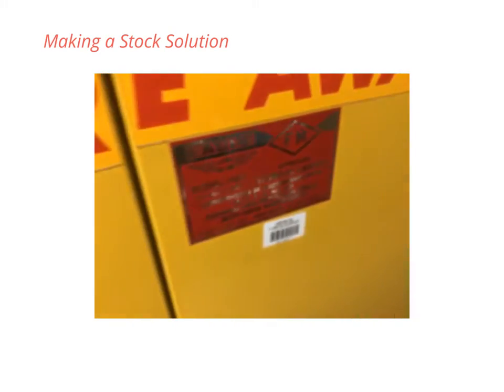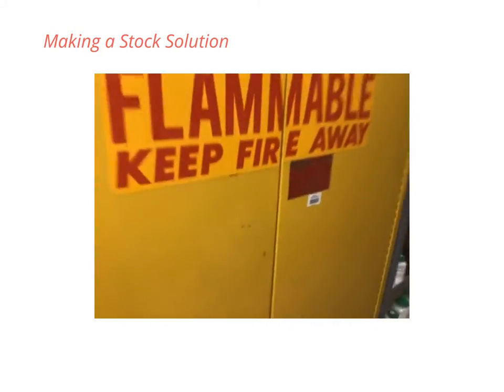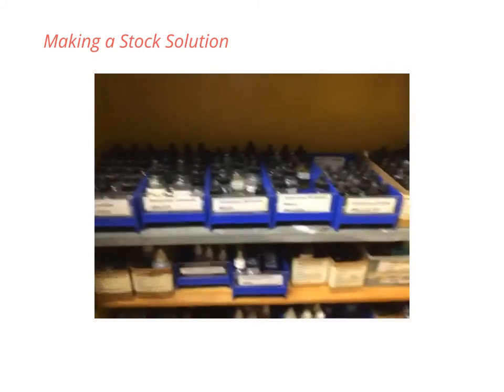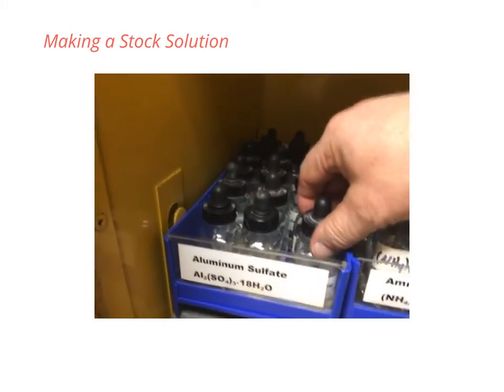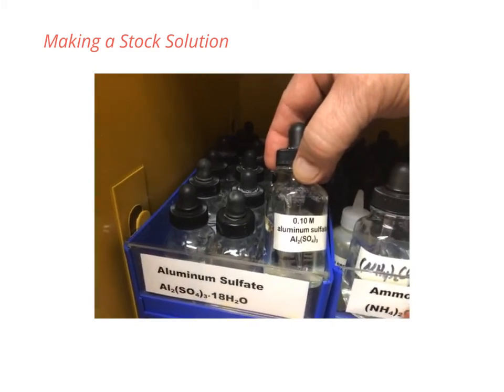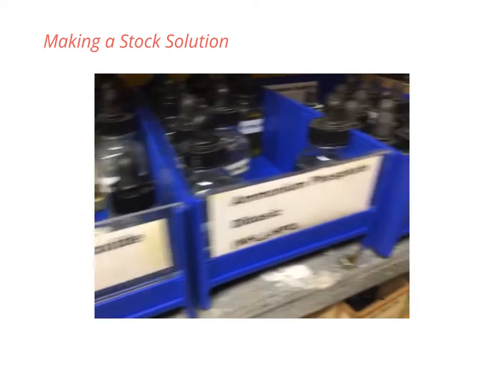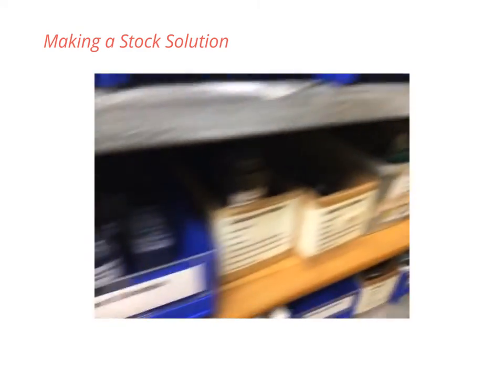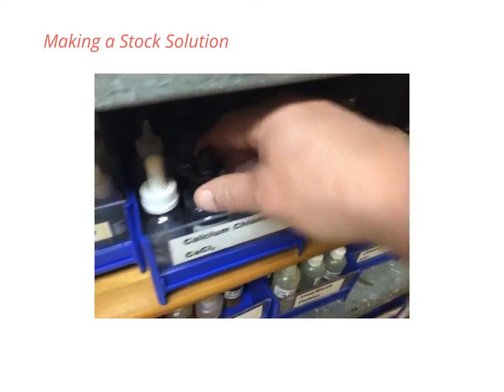Making a stock solution. What is a stock solution? This is the cabinet where we store our chemical solutions we use for labs. Let's take a look. For example, aluminum sulfate, 0.1 molar. We have ammonium hydroxide, ammonium oxalate, barium chloride. Here we have some calcium chloride, 0.1 molar.